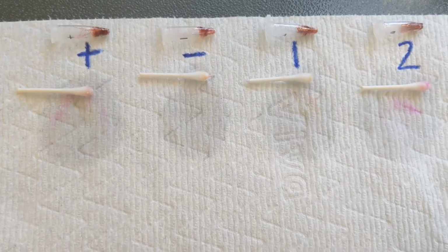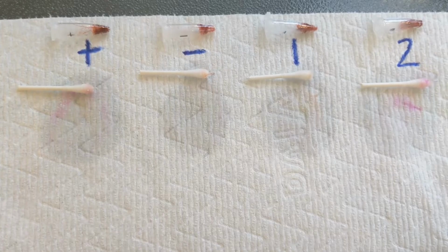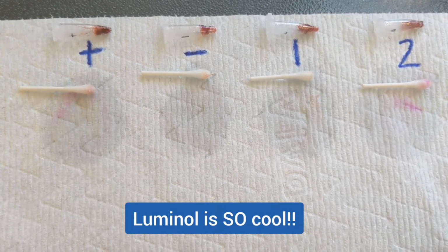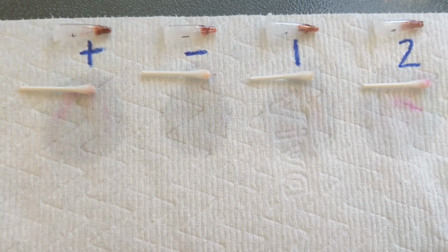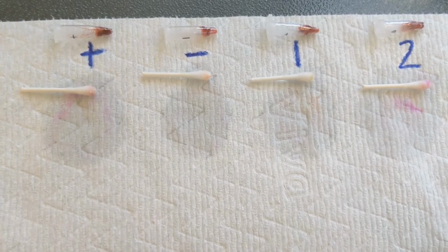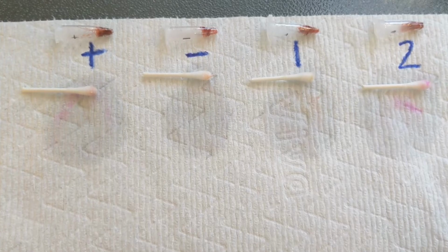And another one is called Luminol, and when you spray the Luminol onto a surface, if there's blood there, it glows blue, really bright and beautiful. That's the one you've probably seen the most in crime scene shows because it looks so cool when they do it. But those actually aren't as common as doing this Kastle-Meyer test.